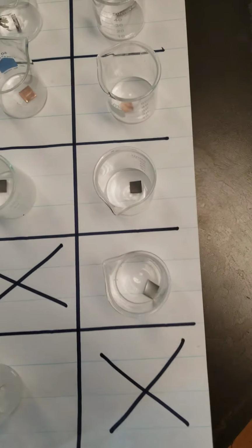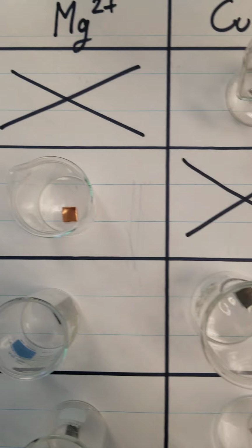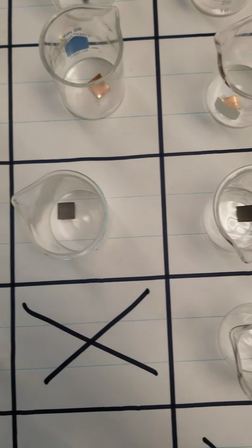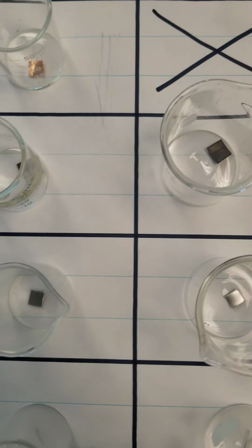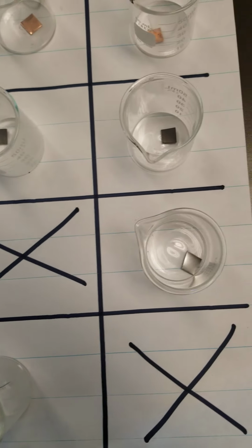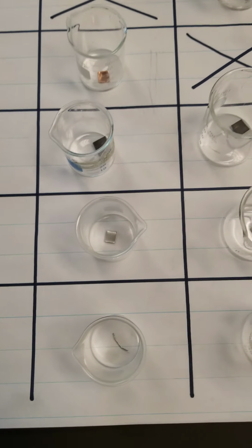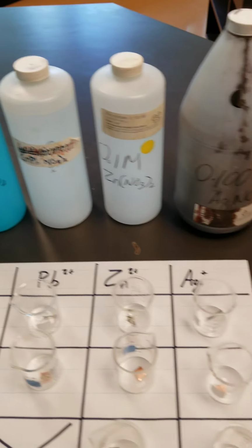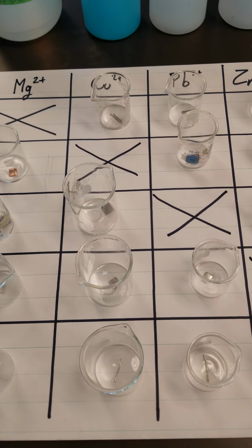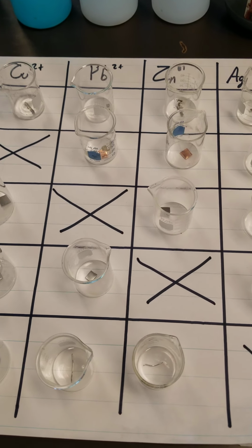Okay, and so we can see that inside these beakers we have just pure metal. There's the magnesium, the copper, lead, zinc, and then we've got some silver wire down here at the bottom. Okay, I'm going to take each of these ionic solutions and pour them into these, and we will start to see some reactions happening and some not having reactions. This is going to help you with that spontaneous and non-spontaneous and how to use that chart.